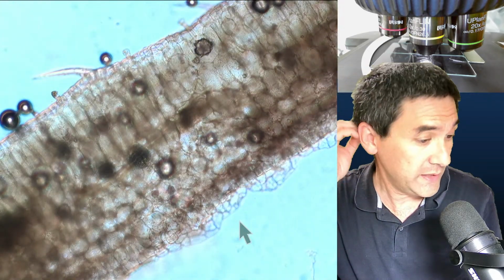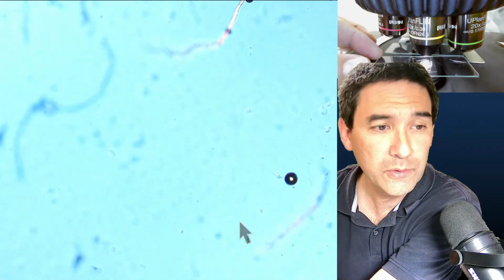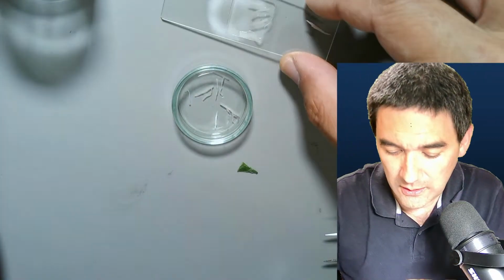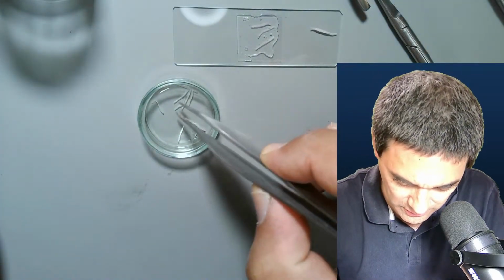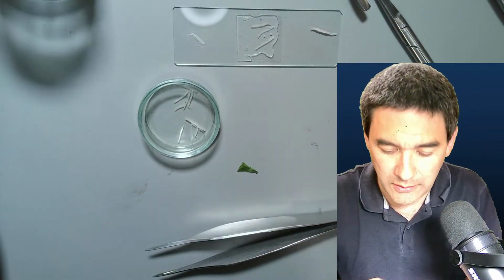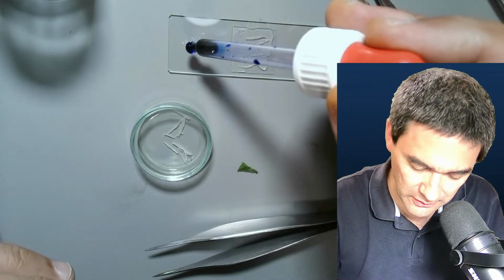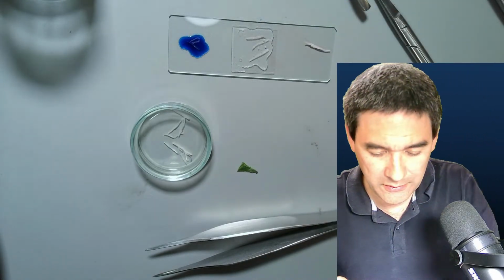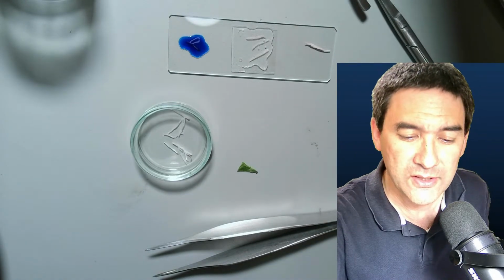And just because it's kind of fun, let's try the following. Let's add a little bit of methylene blue as well. Let's see if I can do a little bit of staining. I'm just looking at the time. I'm going to grab one of those guys here again, whatever looks thin. And I'm going to add a small drop of methylene blue solution, which contains a little bit of alcohol, but it's not purely concentrated alcohol either. So it will now hopefully absorb the stain. And it's actually designed so that you can put a cover glass directly on top of it.